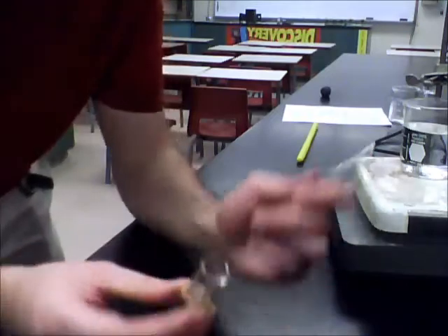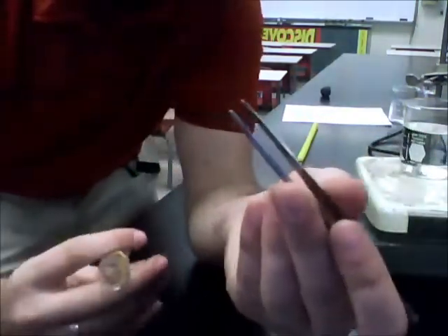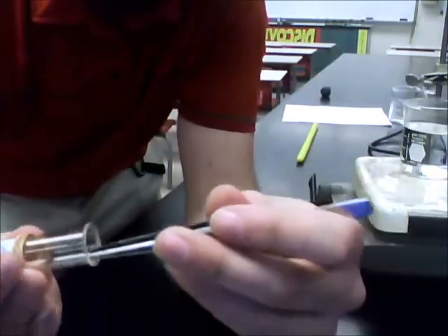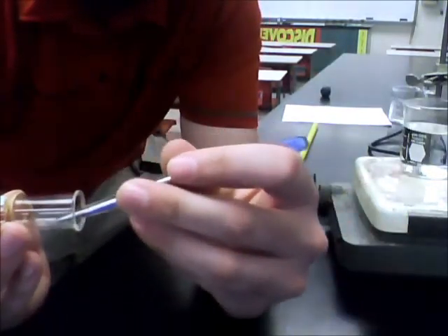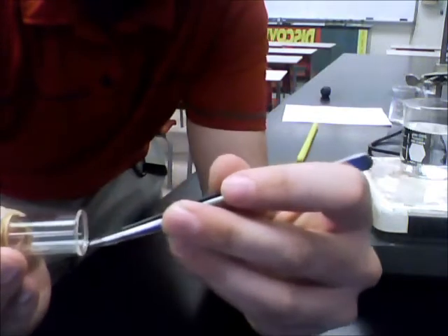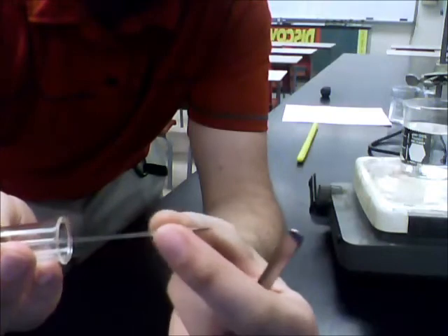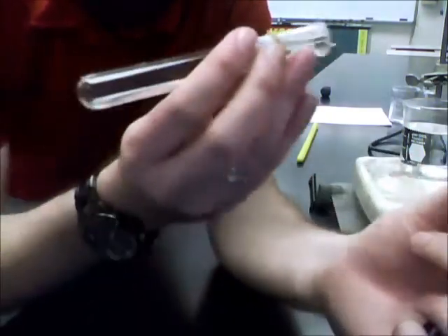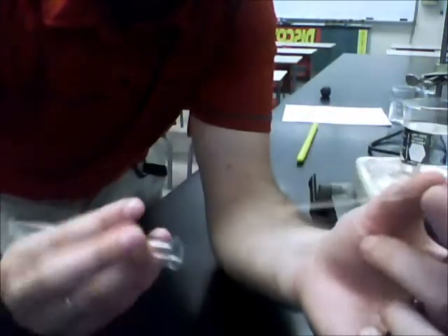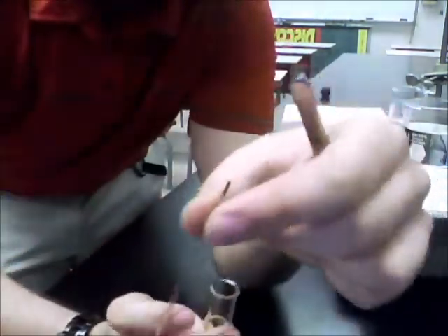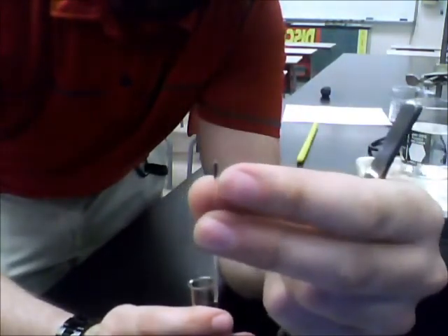Let's say you're having a little bit of difficulty trying to get that capillary tube out of your test tube. All you have to do is get a nice set of forceps and grab the capillary tube very gently. Once it's out like this, you can use your fingers. Again, you want to make sure that the liquid inside is not still hot because otherwise it'll burn your hands in so many ways. Once you have the capillary tube out, just follow your teacher's instructions on how you can dispose of this little chunky end and how you can clean up the rest of your lab.